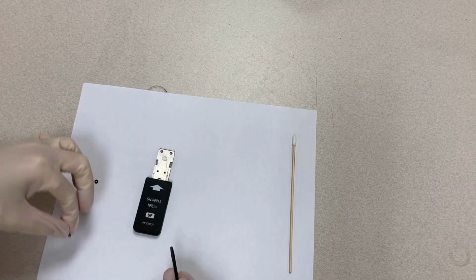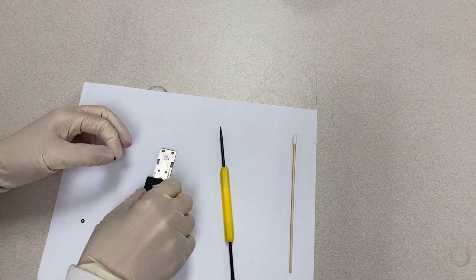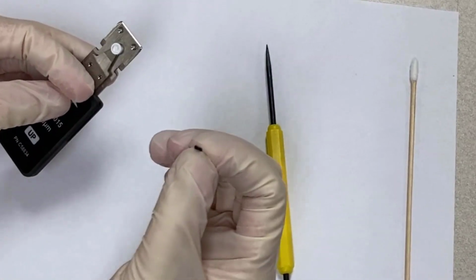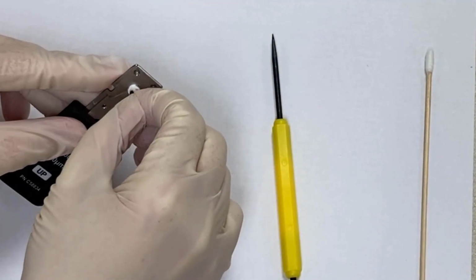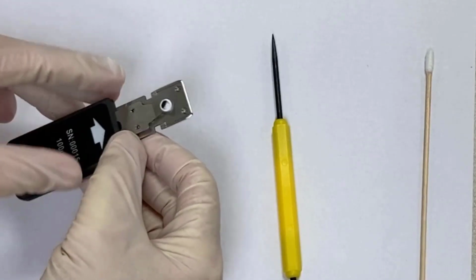Ensure that the groove of the O-ring is free of debris. Ensure that the bigger circle of the O-ring faces down and the O-ring is fully in the groove. Press the O-ring into the groove with a clean swab until the O-ring is completely seated into the groove.